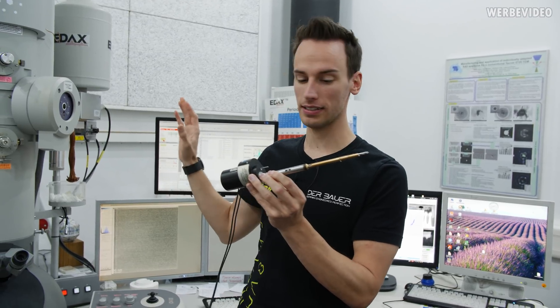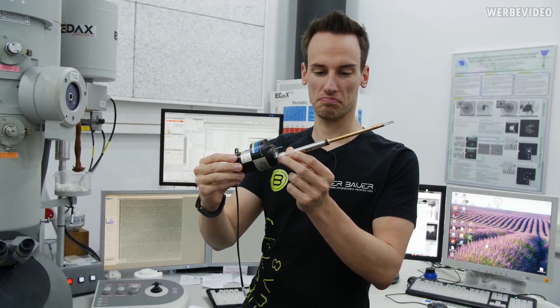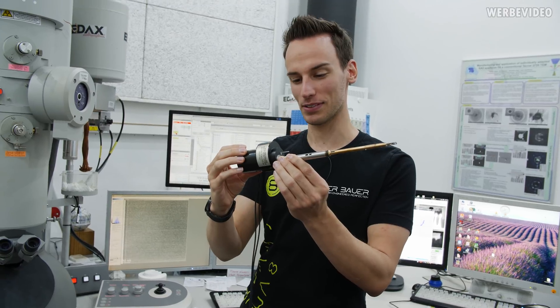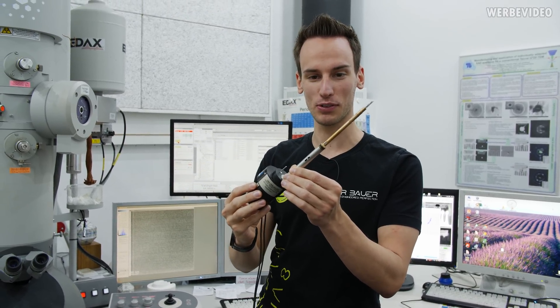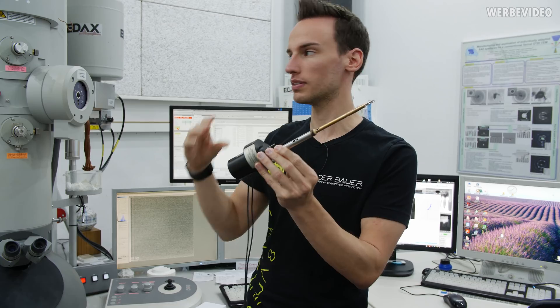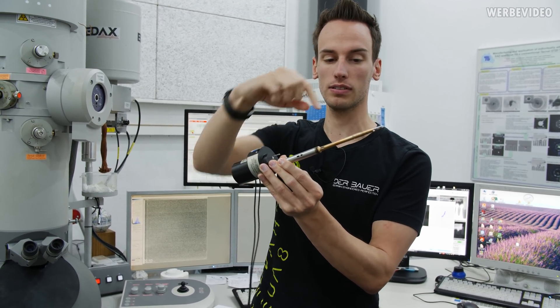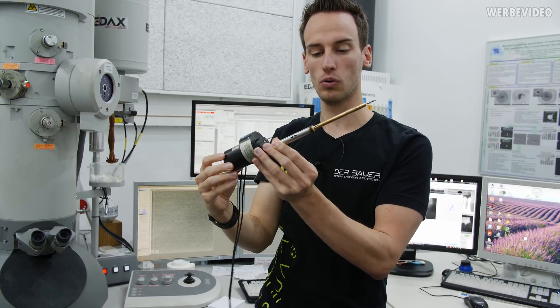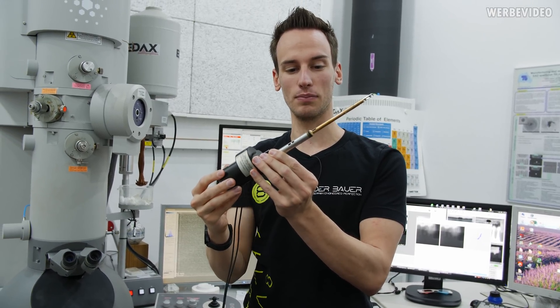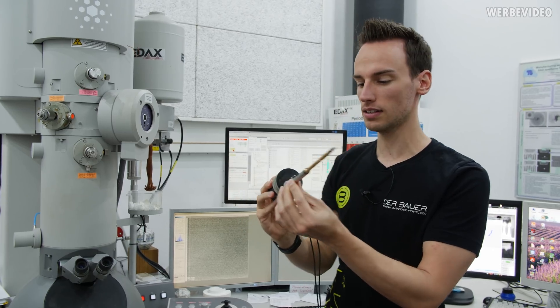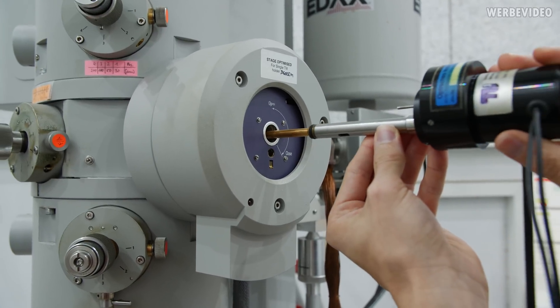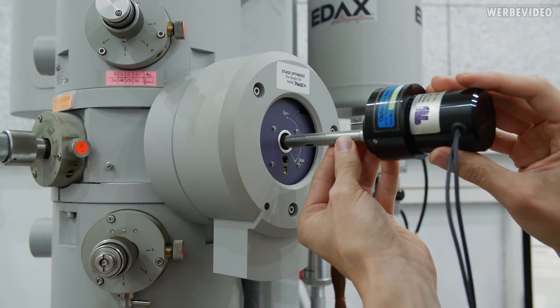Quick voiceover at this point because we were simply not able to shoot this part of the video twice. I'm holding the sample holder in my hand right now ready to put it inside the TEM and I'm really amazed by the price of the sample holder because from the looks it looked like it's like 50 euro but then turns out it's 50,000 euro rather. And you can see in the middle there's a small o-ring which is sealing off the TEM from the outside. So the part on the left is outside of the vacuum and the part on the right is inside the vacuum. They have multiple different sample holders for the TEM depending what kind of sample you want to take a look at. If it's fluid or if it's a solid piece like the 9900K we're going to look at now inserting it very carefully inside the TEM.